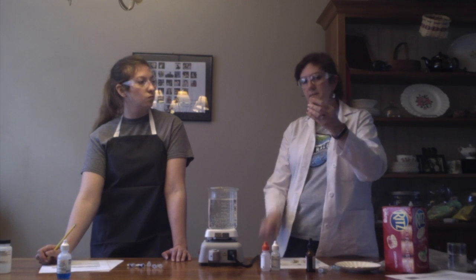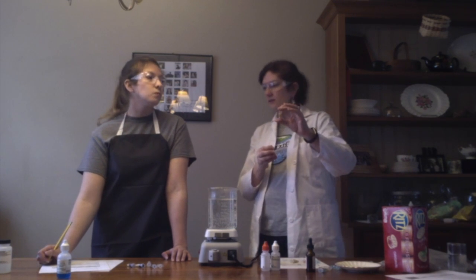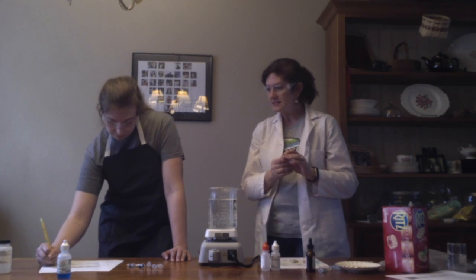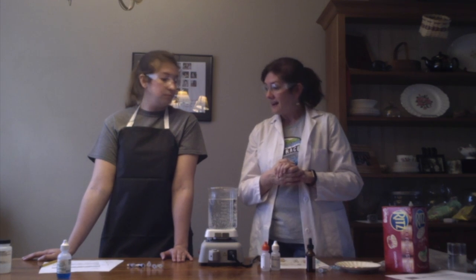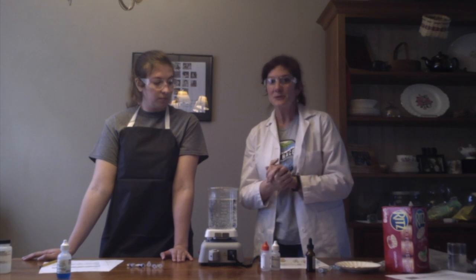Finally, for tube 5, we have our cracker, and this is with the special enzyme in there to help start breaking down the cracker. And we can see when you break down the cracker, it turns this yellow color. So we're definitely seeing that the sugar is present. All right, so that's our data for today. We'll post a picture of that for you online, or in this video even. Once you've done that work, there are some making sense questions for you to complete.